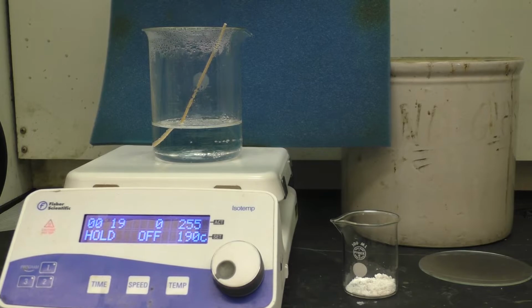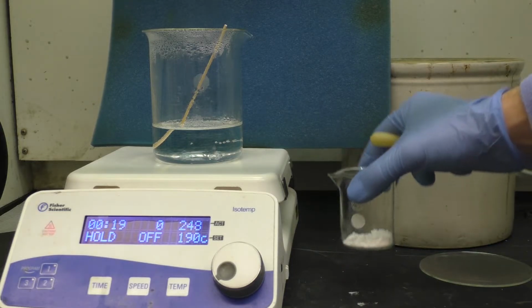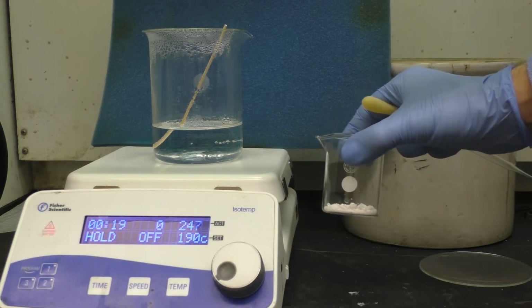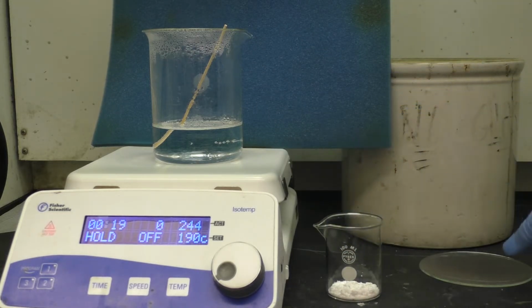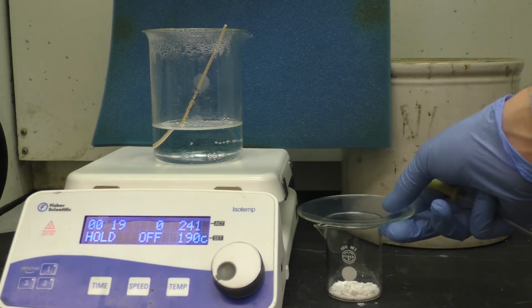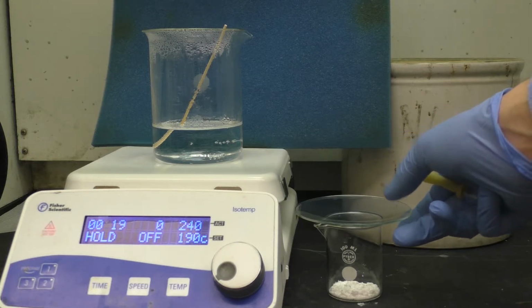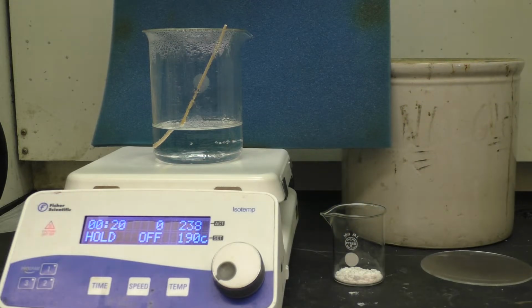So now I'll go ahead and recrystallize the crude material very similarly to how I recrystallized the crude salicylic acid. I've got some hot water already boiling on the plate here. We'll add some of that hot water to my solid crude aspirin, enough to cover the bottom, and then we'll put this on the plate, add some more of that hot water, and then probably place the watch glass on top just to prevent any vapors from escaping and losing volume. And then we'll boil that solution to really try to get everything dissolved. And once everything's dissolved, we can take it off the plate and let it cool.